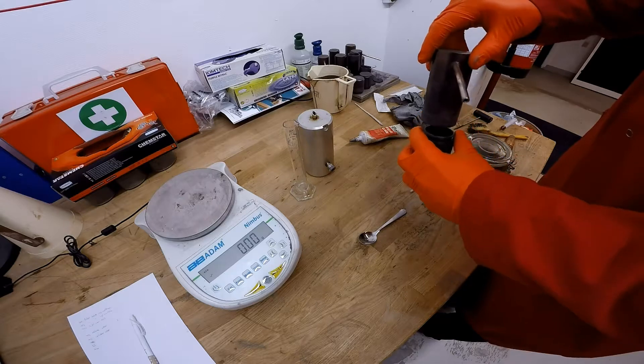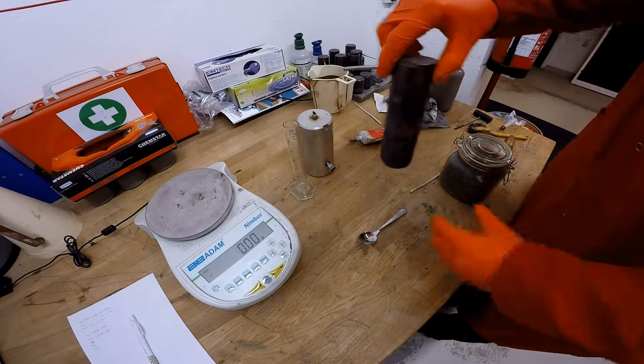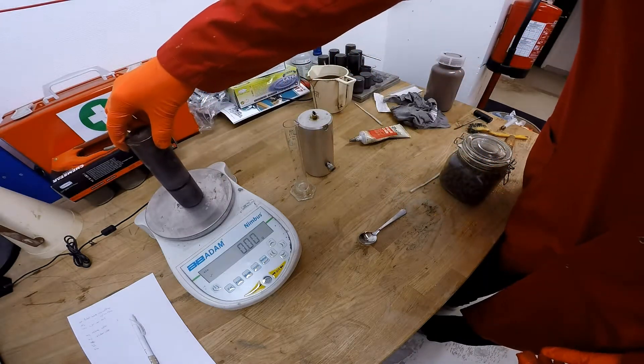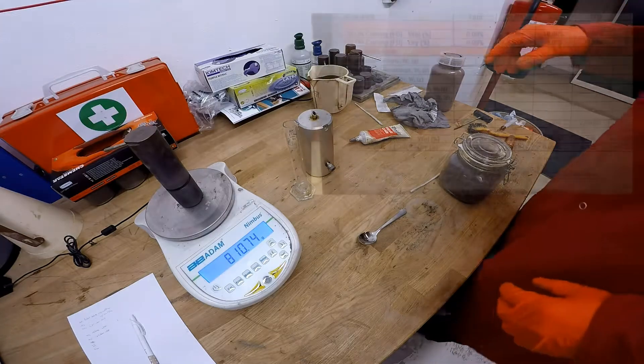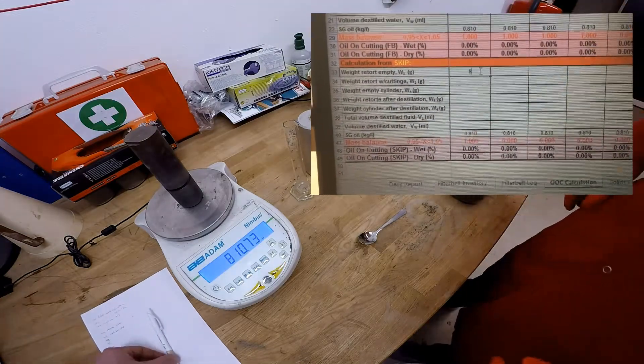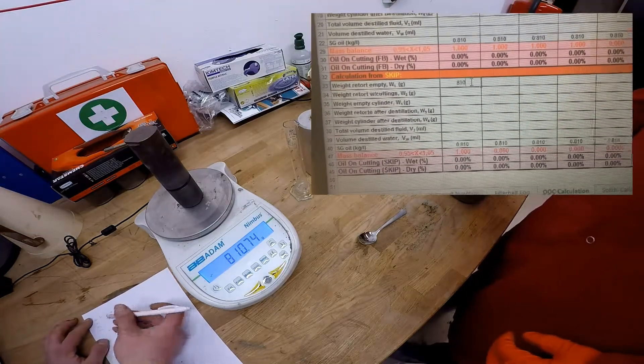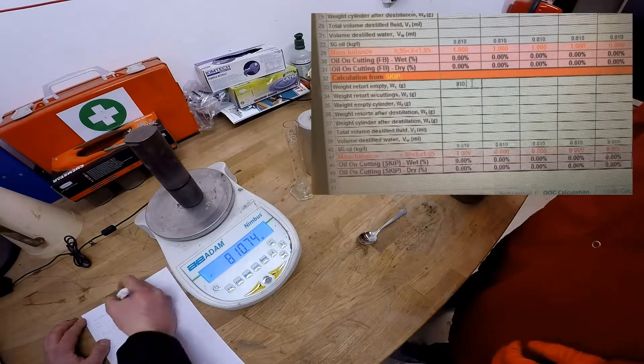Now screw it on just a couple threads and we'll weigh it empty. Now add the figures in your computer, or if you're outside, use a bit of paper and do it later.